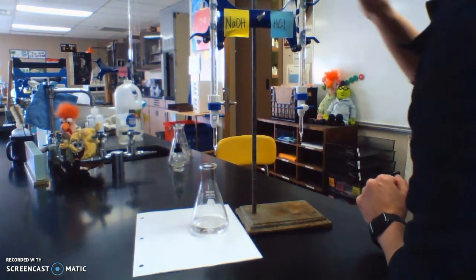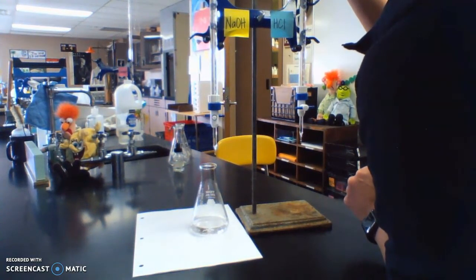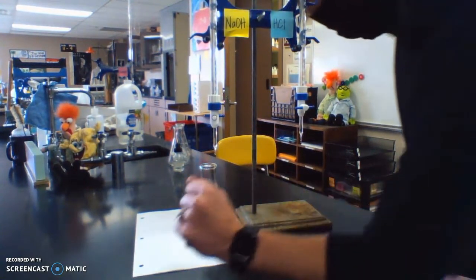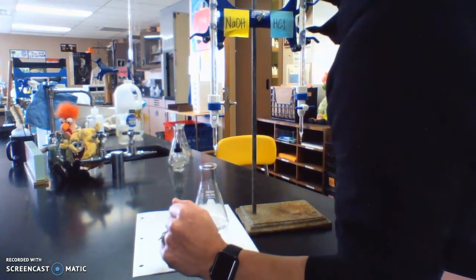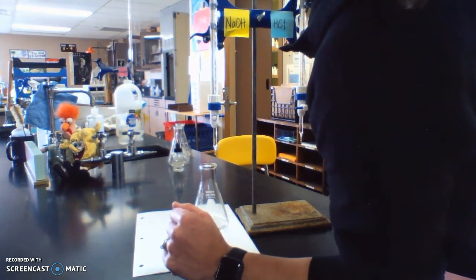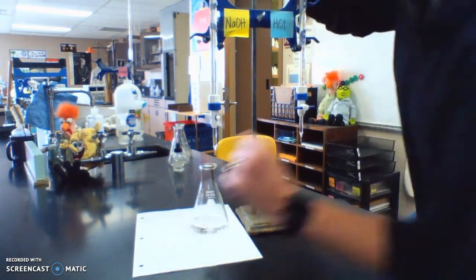So the HCl end volume is 25 point, I'm going to say 12, 25.12. My NaOH is, let me check this a little bit, 20.18.